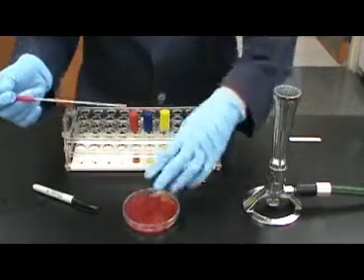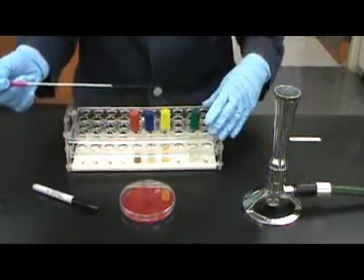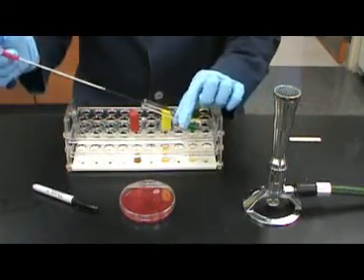The bacteria you will be handling can be very virulent, so be very careful when carrying out inoculations. Be sure to use universal precautions and dispose of all waste in the biohazard container.